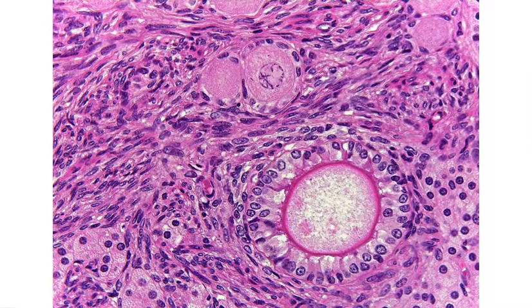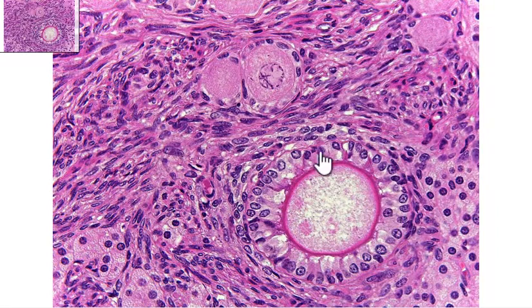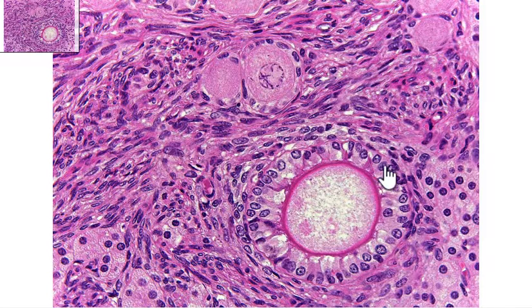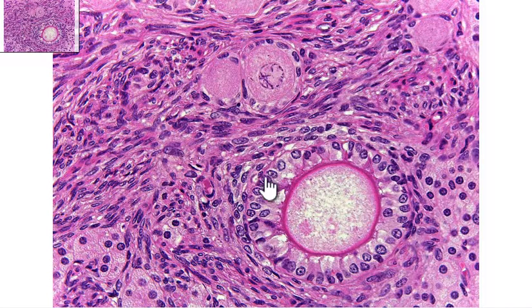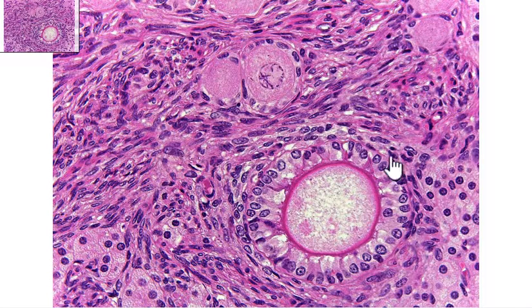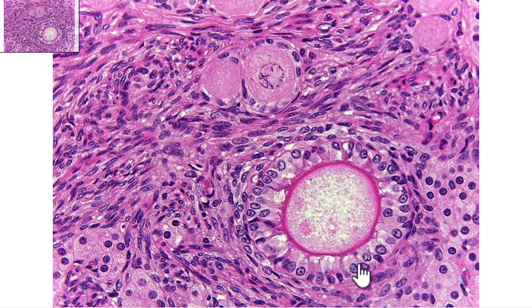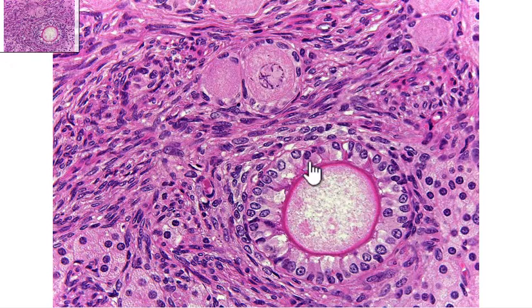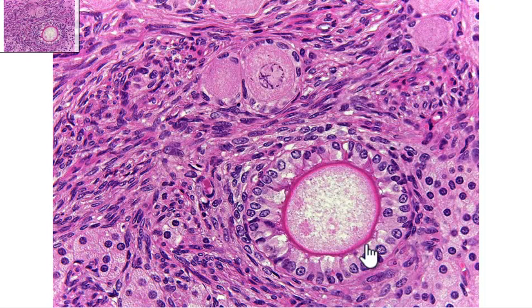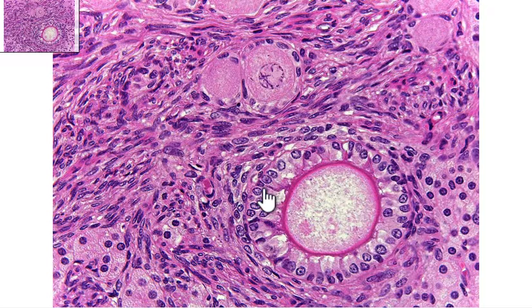You can tell it's a primary follicle because the epithelial tissue surrounding it is not flat squamous cells. These are either going to be cuboidal or columnar — there's more height to them. But still, it's a single layer.